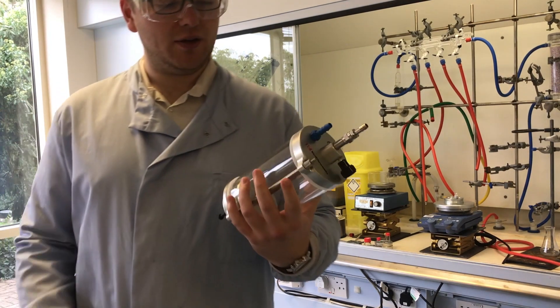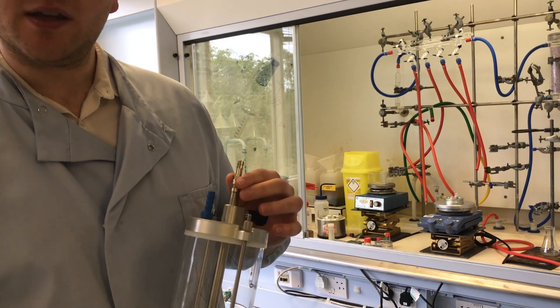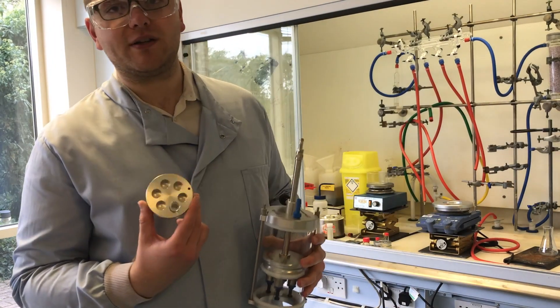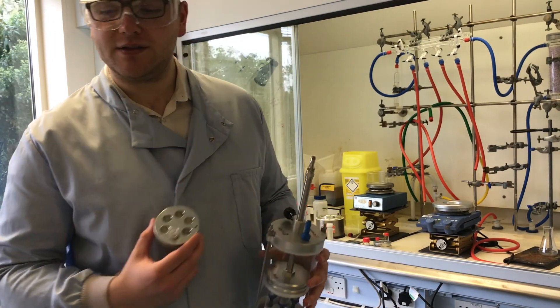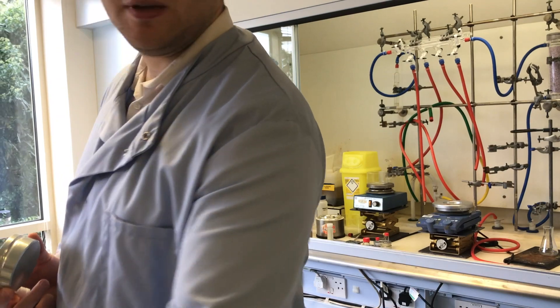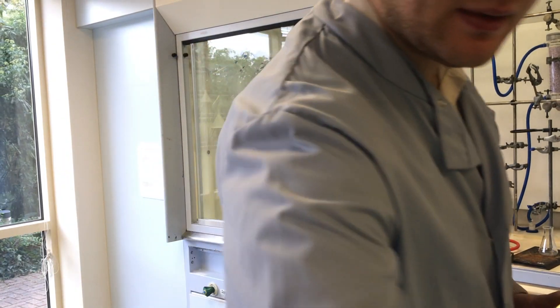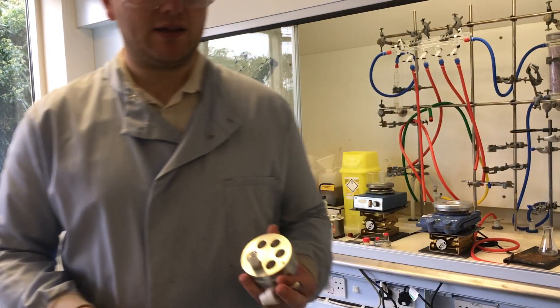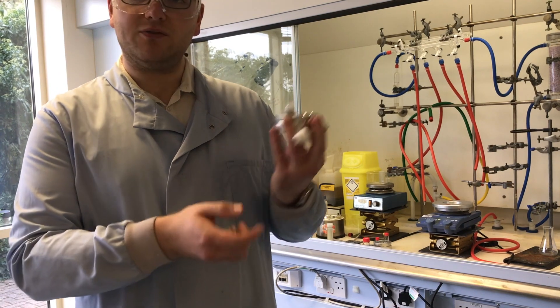Hey, so today I'll be showing you how to set up the DrySyn spiral evaporator. It works with all of our existing DrySyn reaction vial inserts, and to begin with, all you need to do is choose the right size plug for your vial.